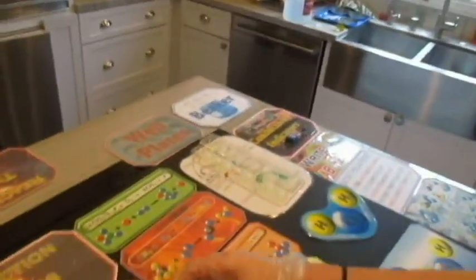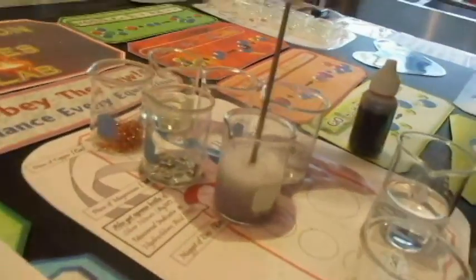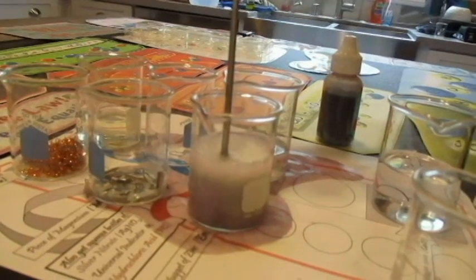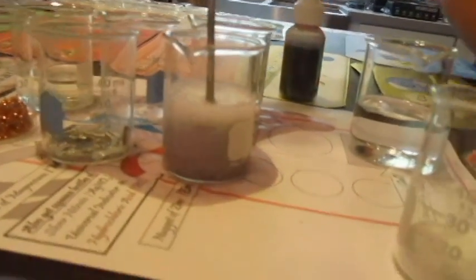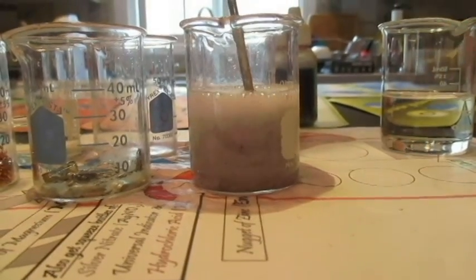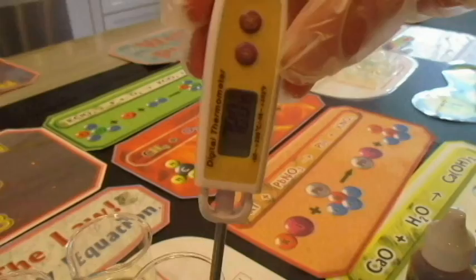So see all this? This is the dog of chemistry. Lucy, what is the dog of chemistry? The one that barks. The one that barks is hydrogen, the most abundant element in the universe. Look at that cool bubbling effect. I'd say like 76 point. Oh, has it gone up that much? Yeah, it keeps going up.